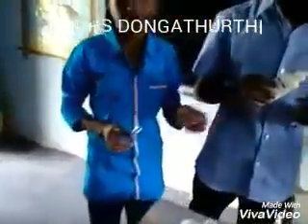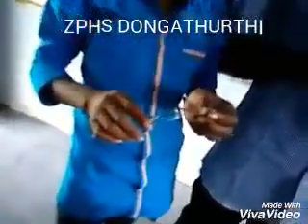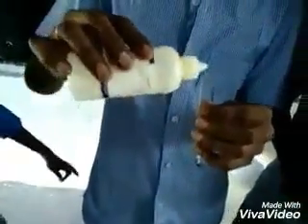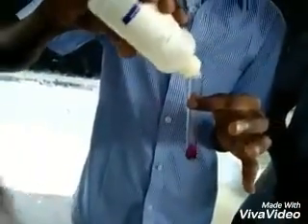The first student tests the red litmus paper with potassium hydroxide — the red litmus turns blue. The second student tests potassium hydroxide with phenolphthalein indicator — it turns pink.